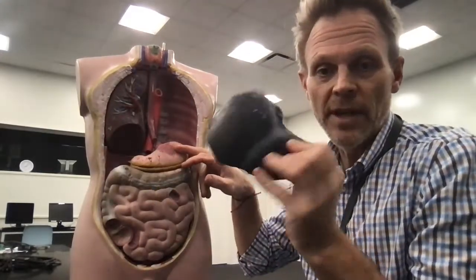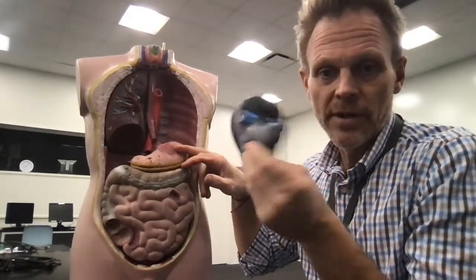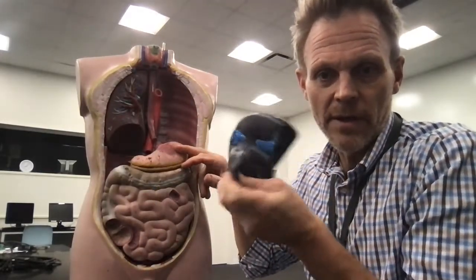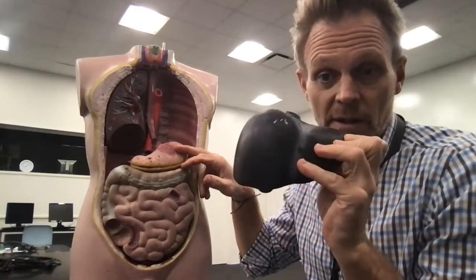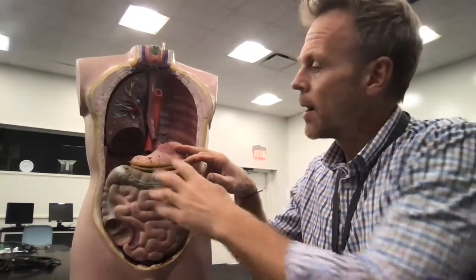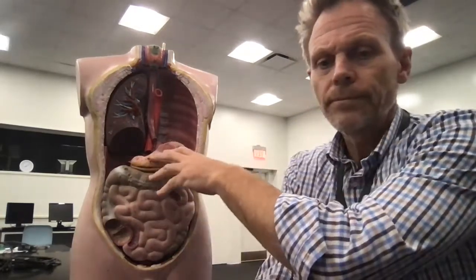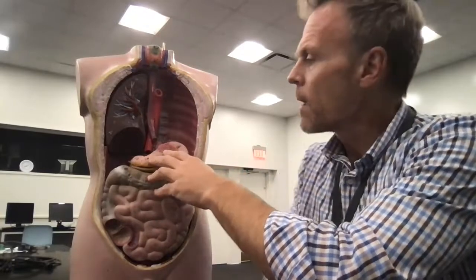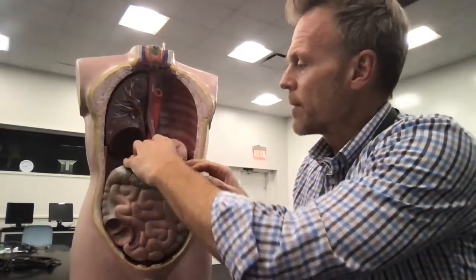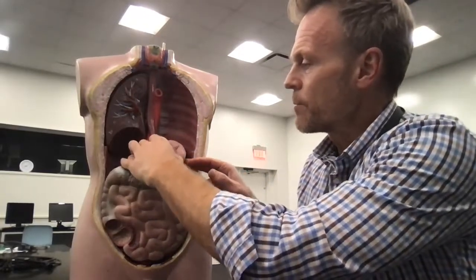I'm going to remove this first. It's got a gallbladder tucked away in there. This is called the liver. So here we have our stomach. The stomach's actually quite a small organ.